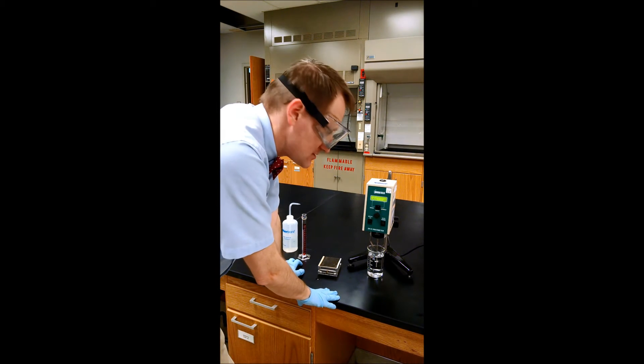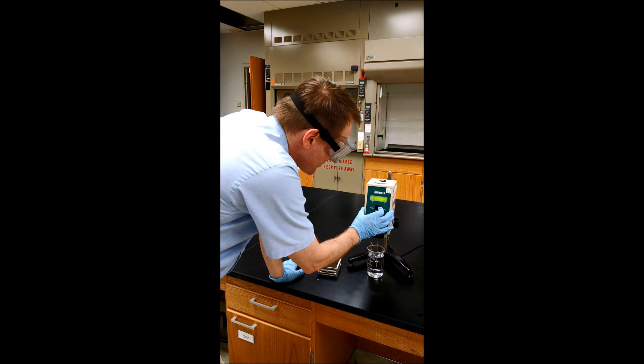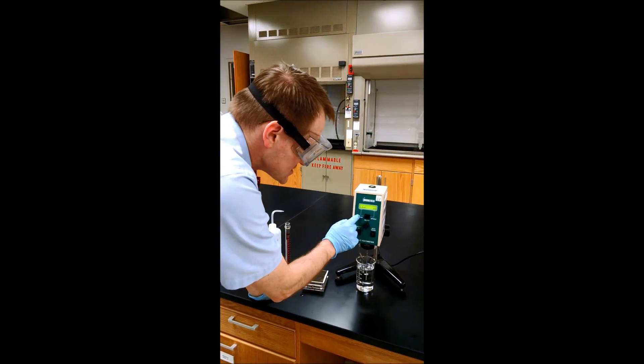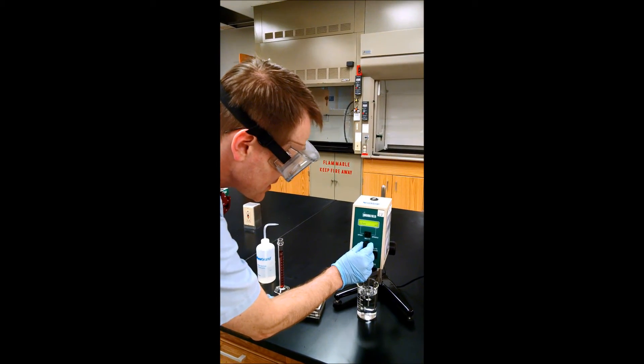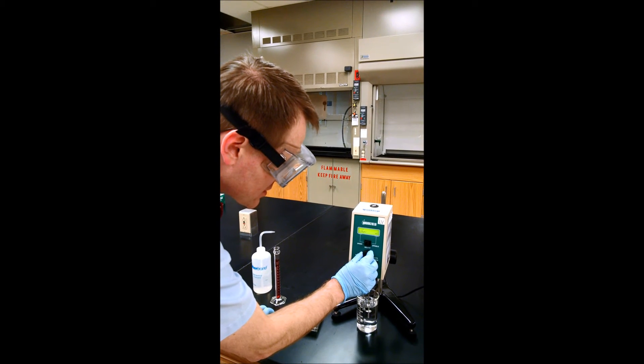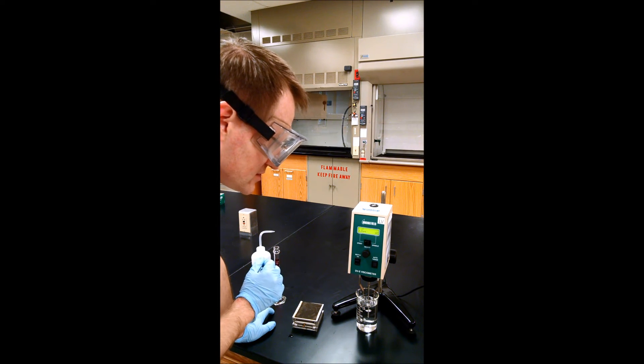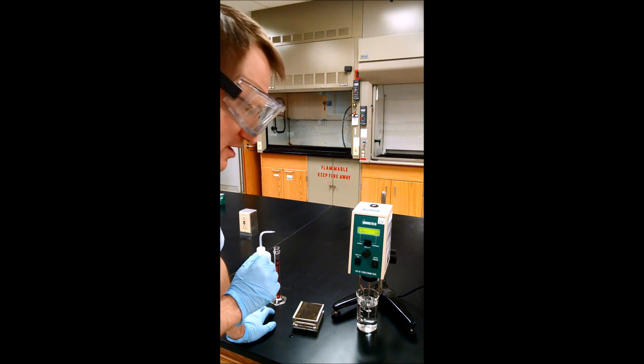Right before we do that, we want to make sure we have the right speed selected. We switch to speed, here's the speed display, and we can go from 0.1 to 100 rotations per minute, RPM.